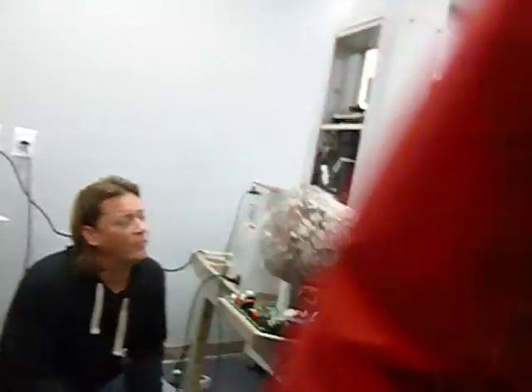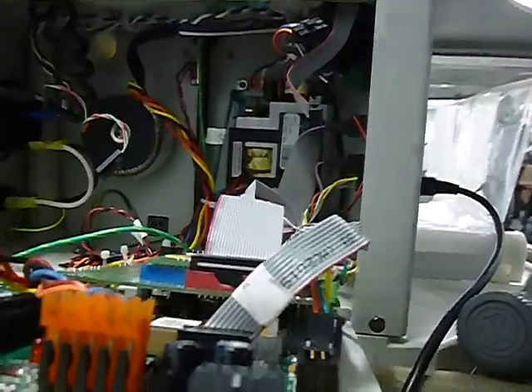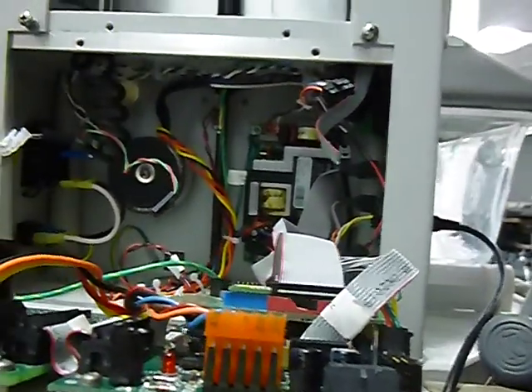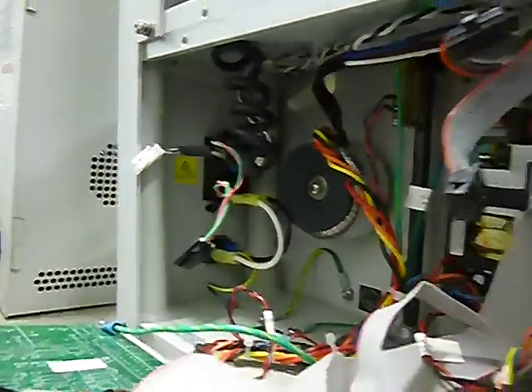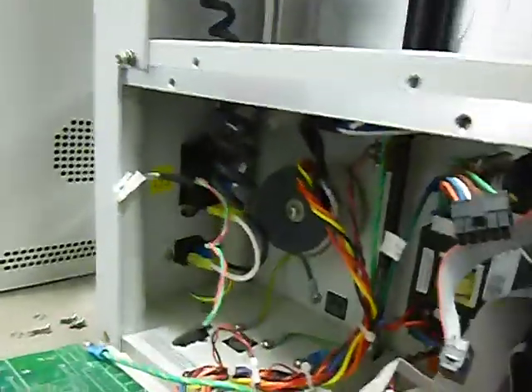It just sits down inside there. But the only reason you need to get in there is when you're running it down to the bottom, you can look, you'll see. You have to make sure it gets in there because I put one in one time and it wasn't in there. And about 20 minutes after I put it in there, it slid into place and everybody in the lab heard it and everybody jumped because they thought something blew up. Because it made a really loud noise. When it popped into place, it was loud.